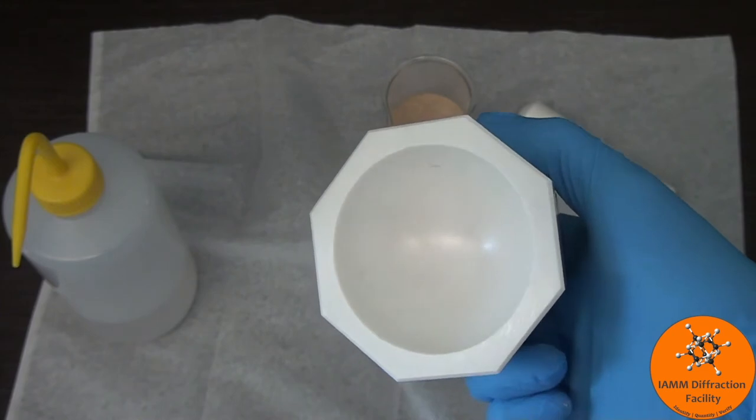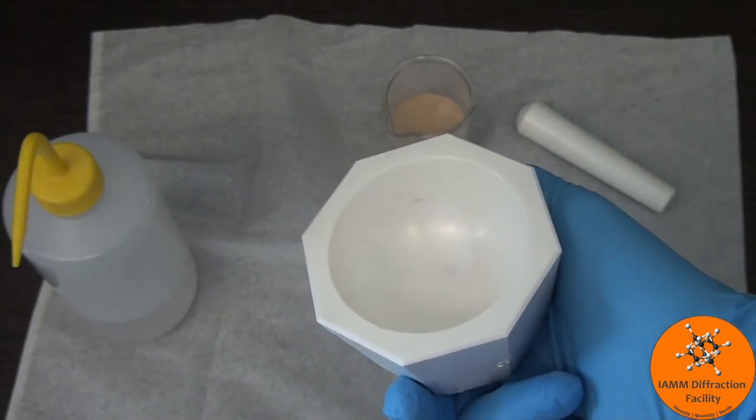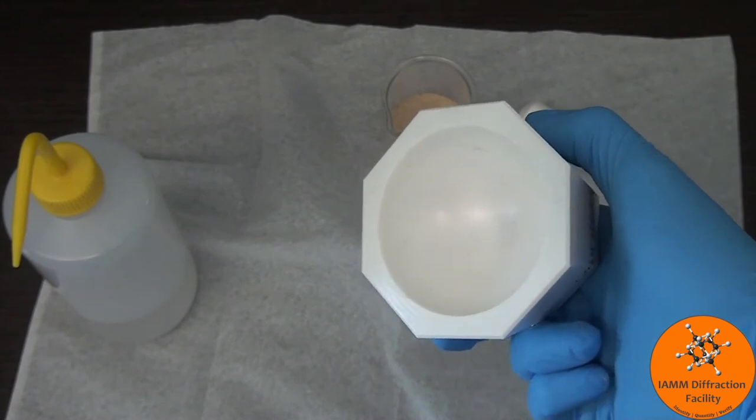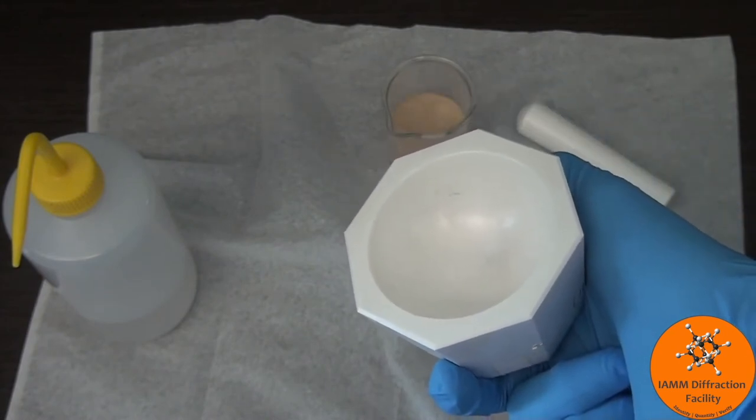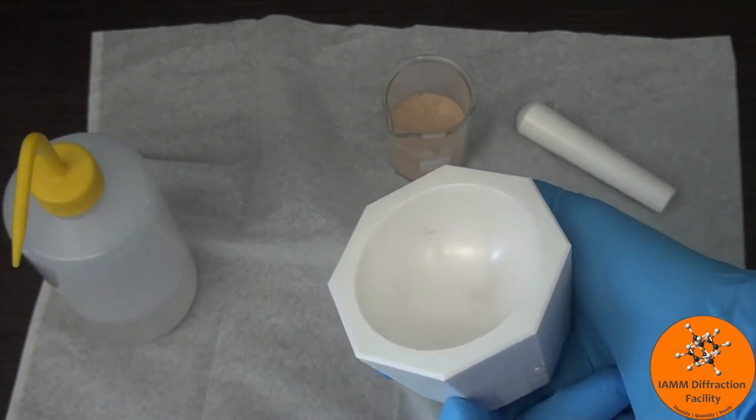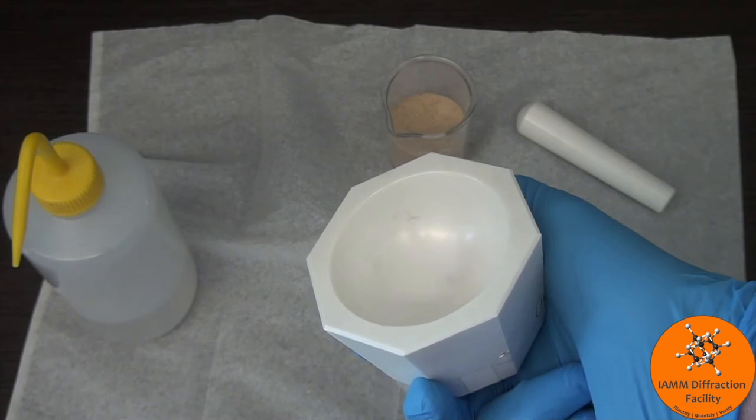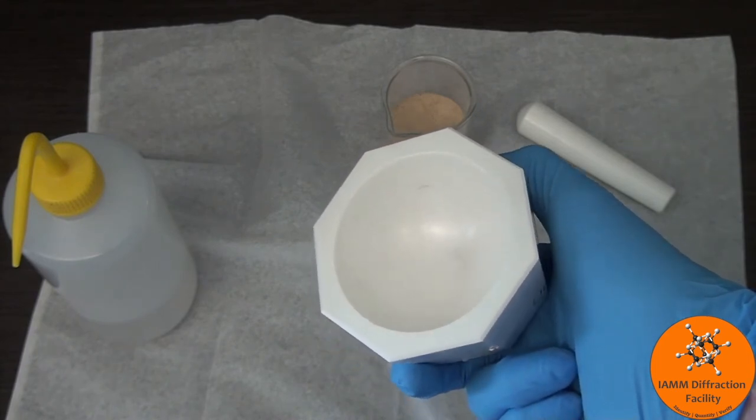It's looking better. It still has quite a few marks in it. Sometimes you're going to find that you have to do this process multiple times. I'm going to continue this off camera because it's very difficult to try to grind this all while on camera. So I'll be right back, and we'll see if I can get this looking any better.